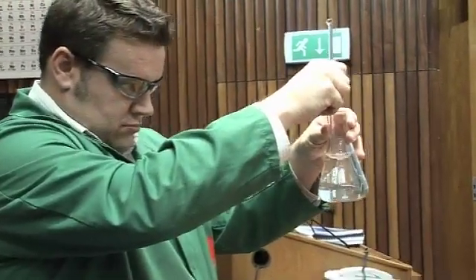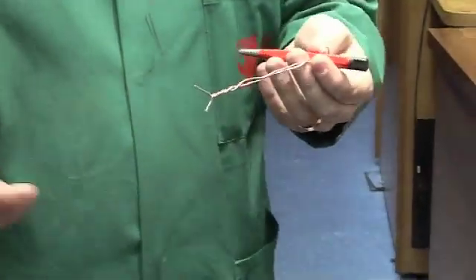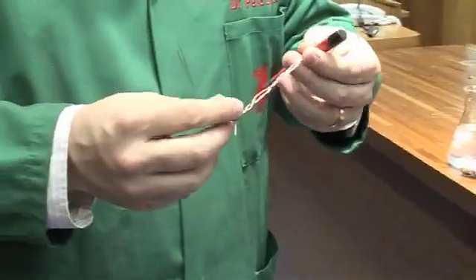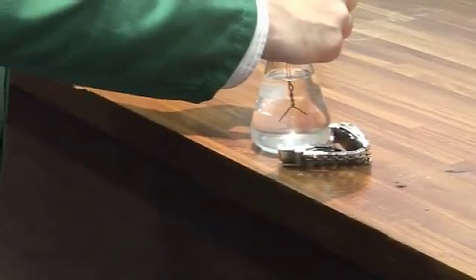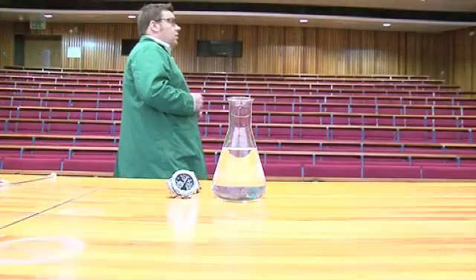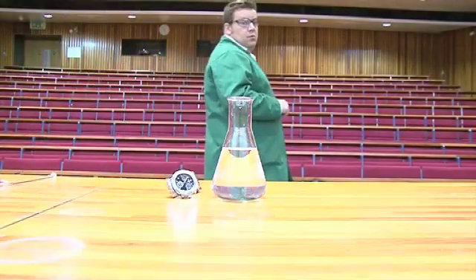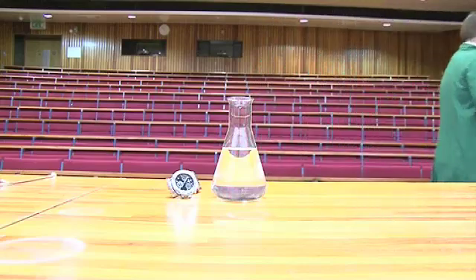Now we've got to put in the competitor. We're going to take some copper — copper metal — just a sample of wire which I've rubbed with wire wool to make it nice and shiny. Now I'm going to dangle it into the silver nitrate, and it's going to start to compete for the nitrate and we'll see what happens. Brady's started the recording, and the best thing for us to do is go away and do something a little more exciting, then come back and have a look in an hour.